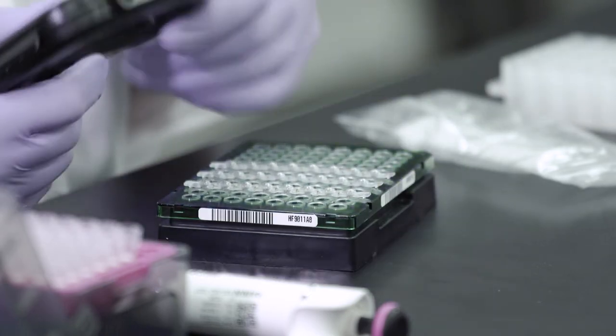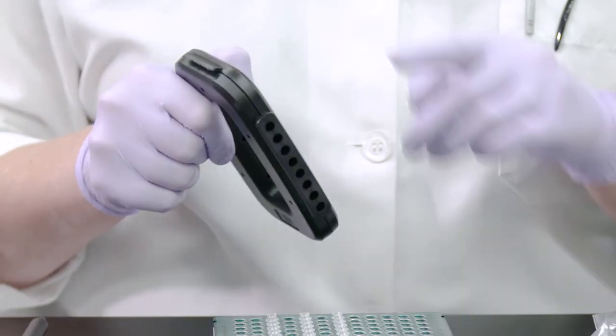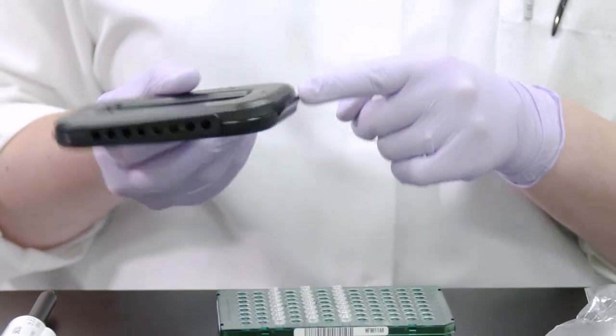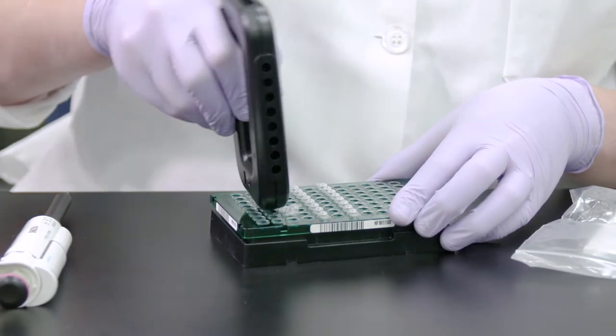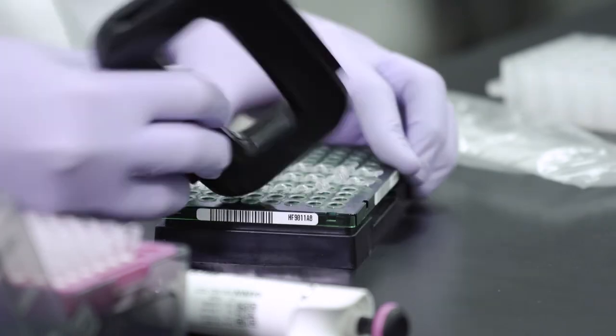The cap installing tool will also open the caps with ease. Insert the small protrusions on the side of the tool between the caps on the cap strip and slowly pry the cap strip from the plate.